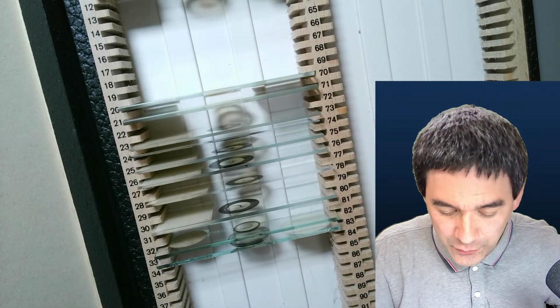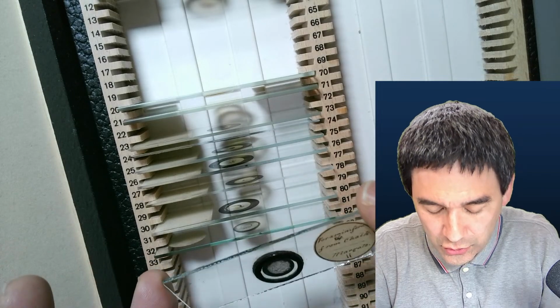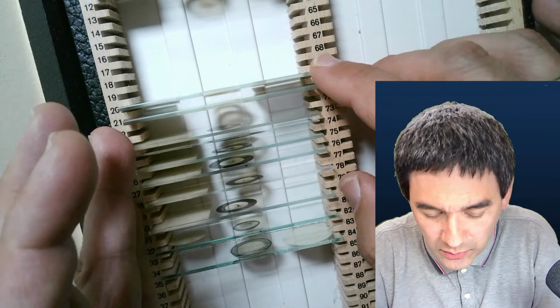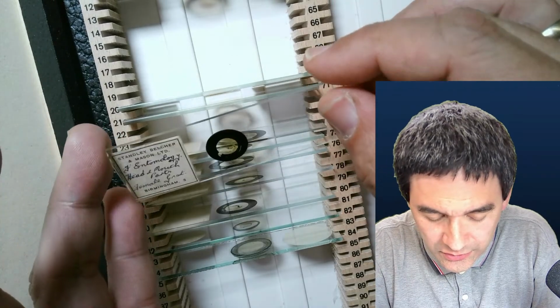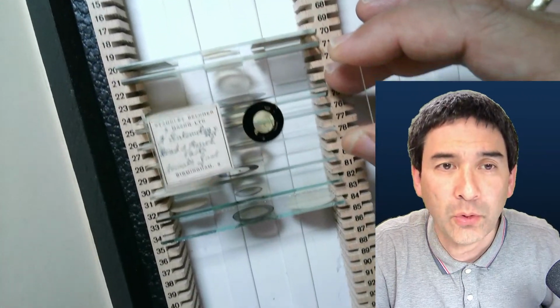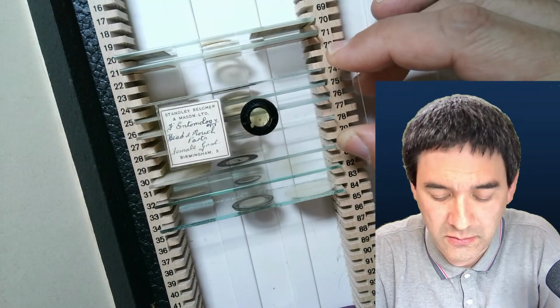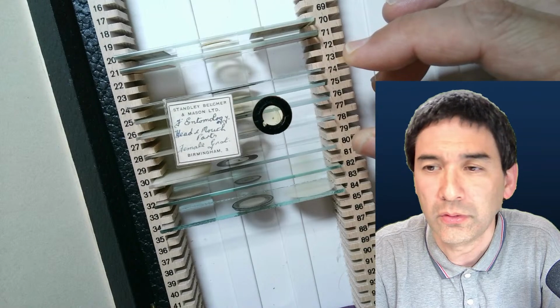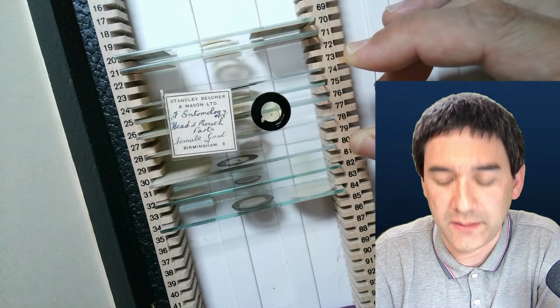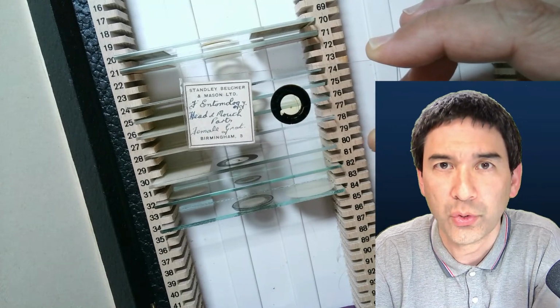So a few things here. Last week I wanted to show you some of those slides, but we didn't quite get all the way through. So I'm going to have a set of entomology slides. Entomology, basically the study of insects. And these slides are a little bit older. Some of them can be maybe 100 years old, and I'm going to just look at them with you, and then I'm going to show you what I've done here.